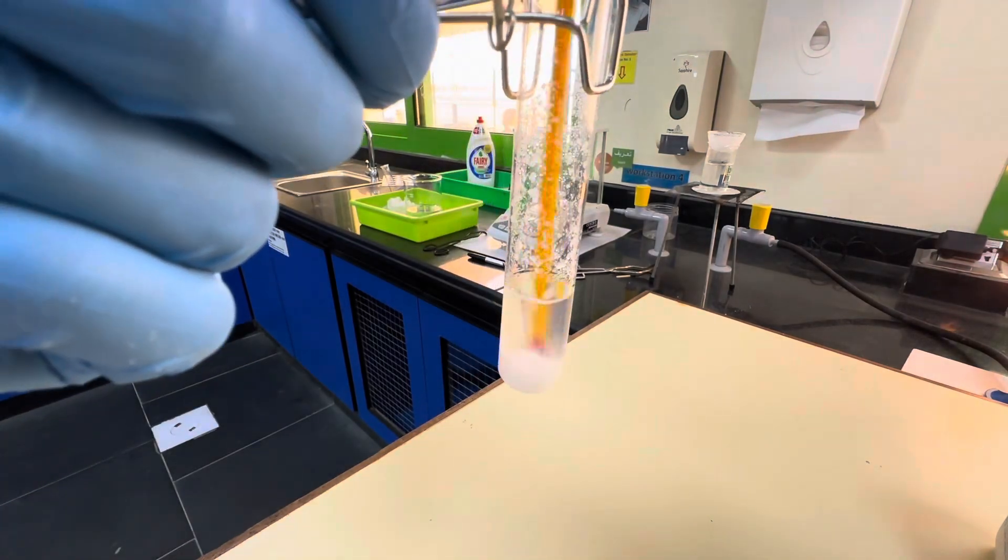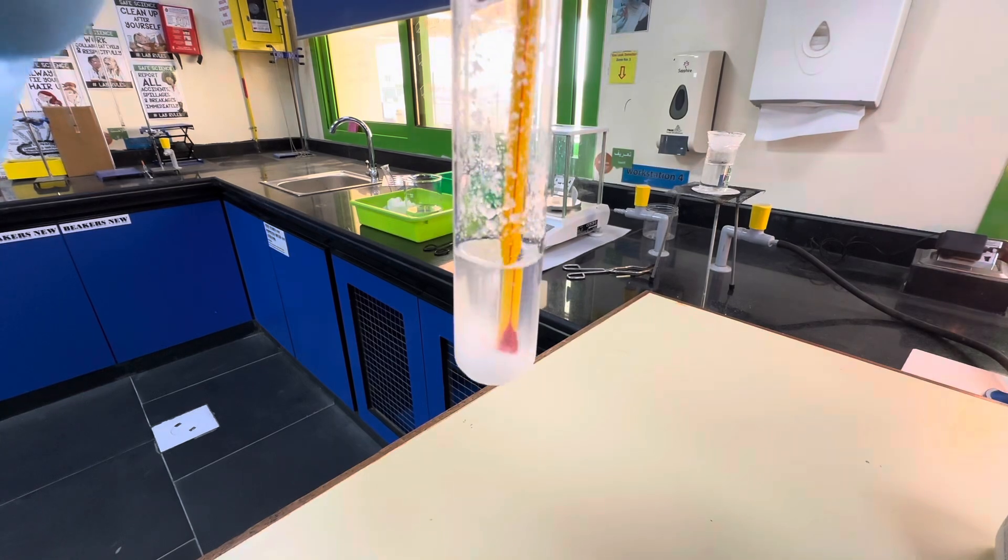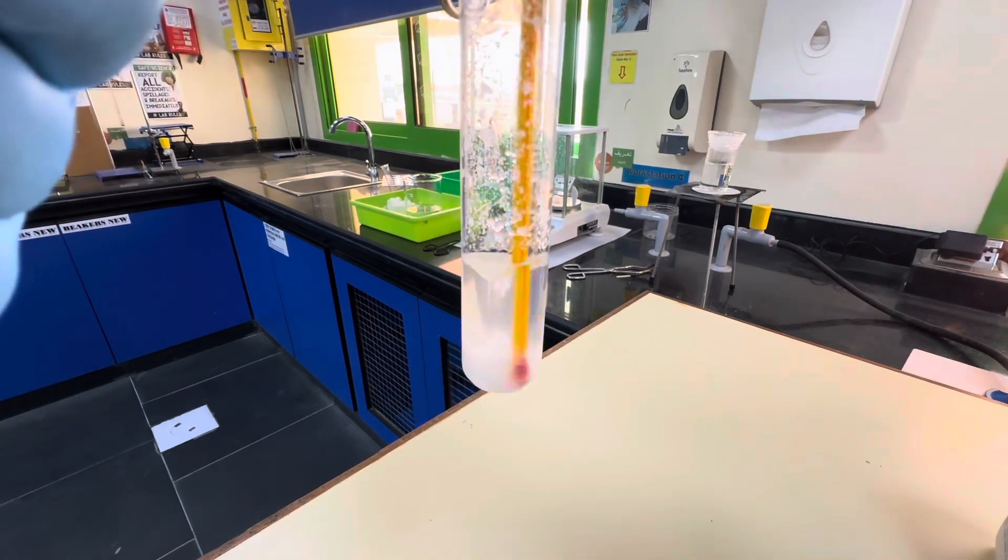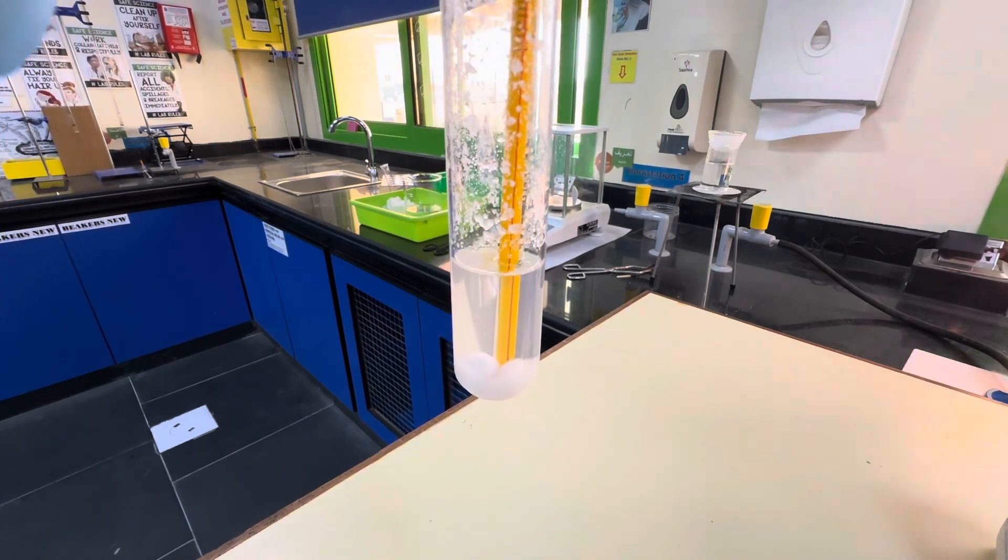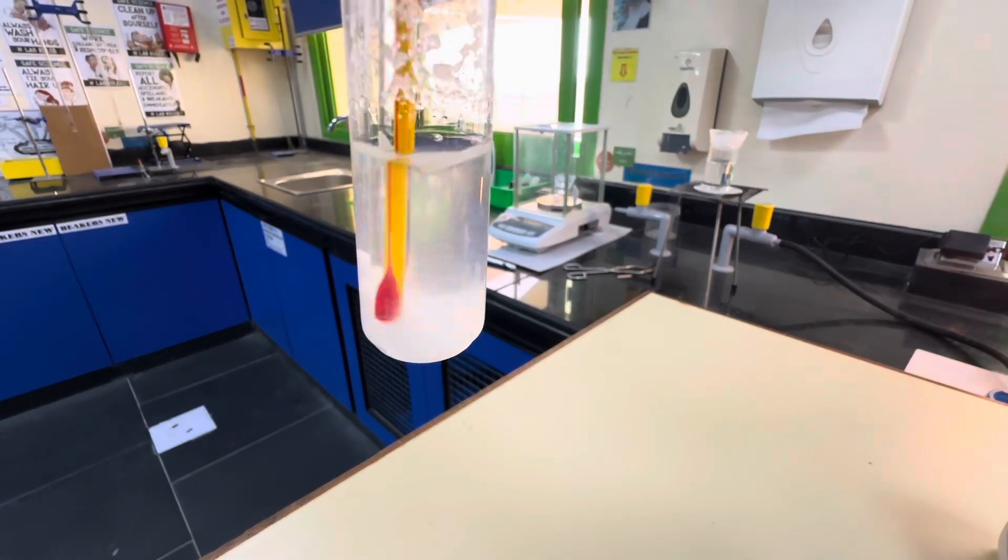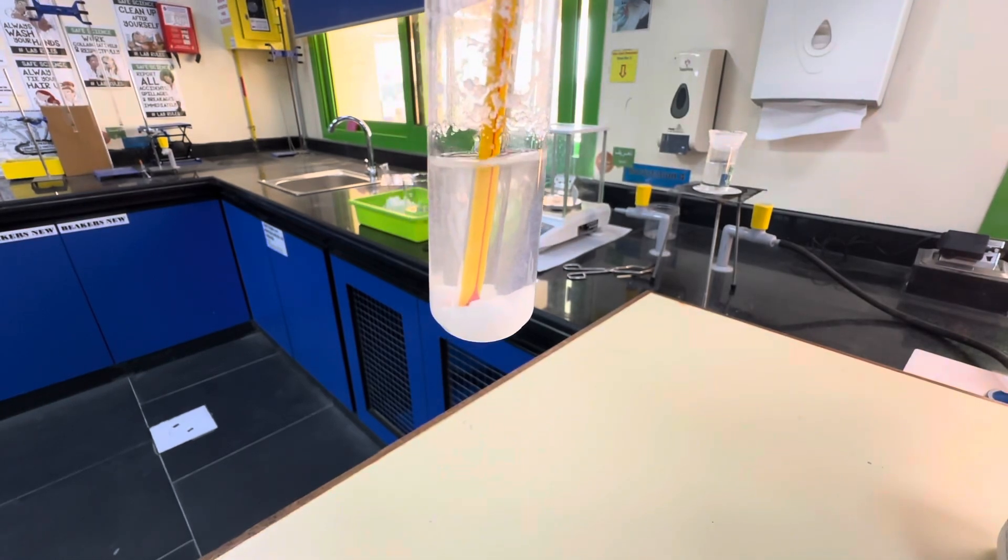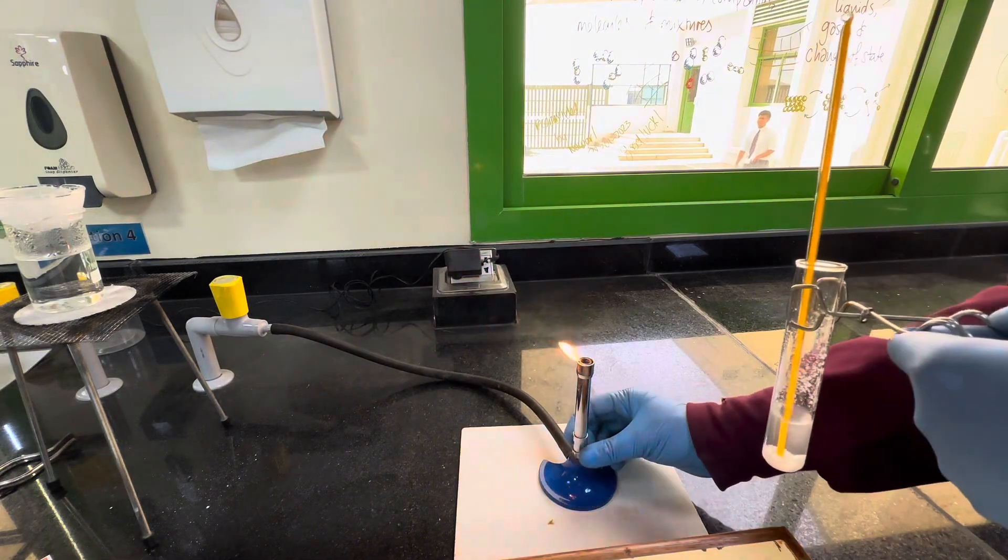We have reached the stage where it looks like there's a saturated solution now but the temperature is now down to 30. So I'm going to heat this up again and see whether we can progress on. If it stays with the solid at the bottom and reaches 40, then we know that we have a saturated solution and we can carry on to the next stage.